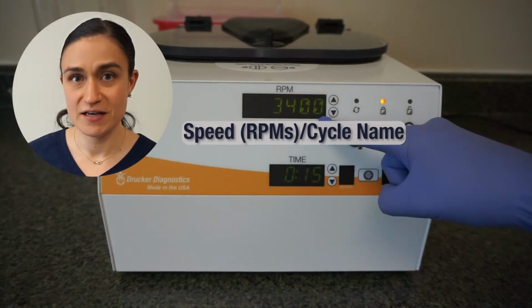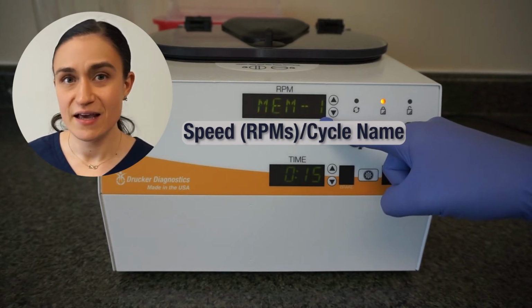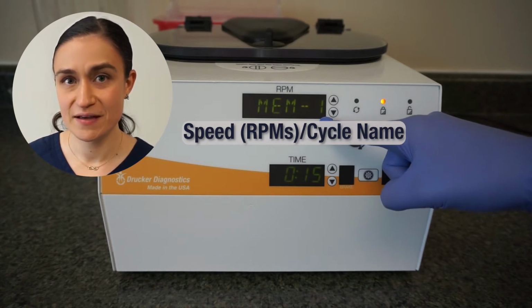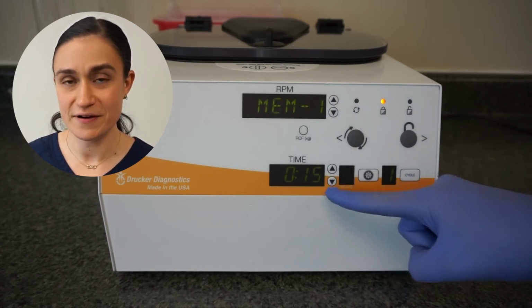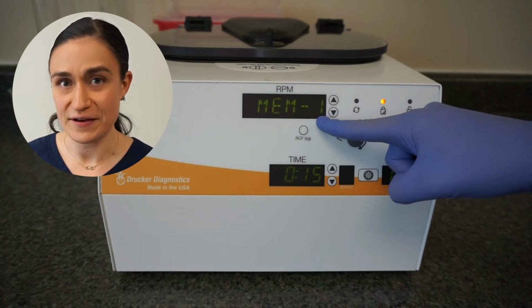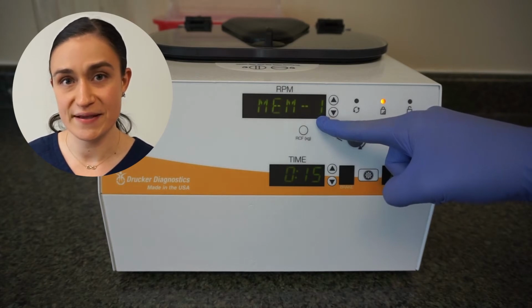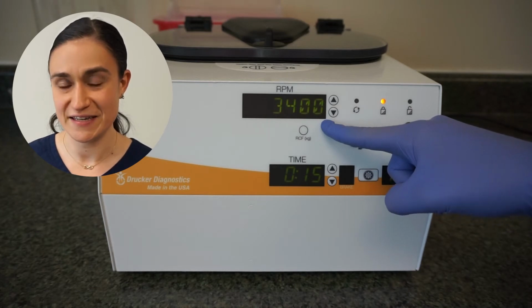As a reminder, your SERO 12 has all of its controls on its front panel, right here. The RPM screen, which shows your currently selected RPM. When you have a cycle selected, it will alternate between showing the RPM and the name of that cycle. Keep in mind that when you do have a cycle selected, every value on every screen on the front of this centrifuge is going to show the value associated with that saved cycle. So if I have a cycle of 3,400 RPM, 15 seconds, and no braking, that's what's going to show when I have that cycle selected.